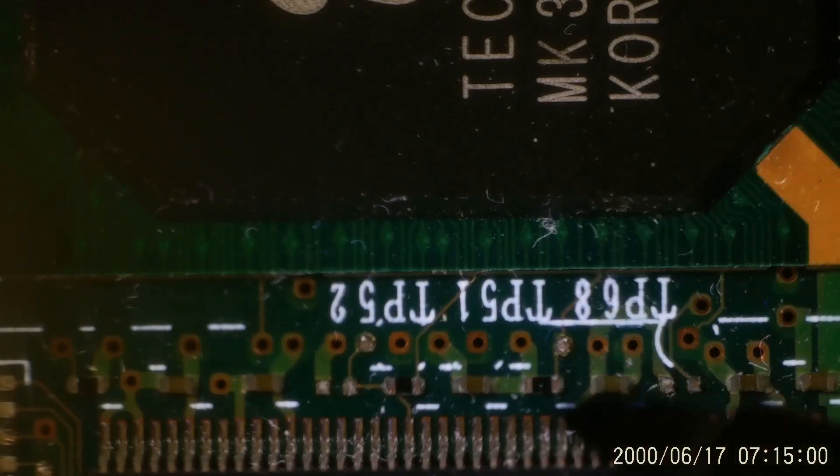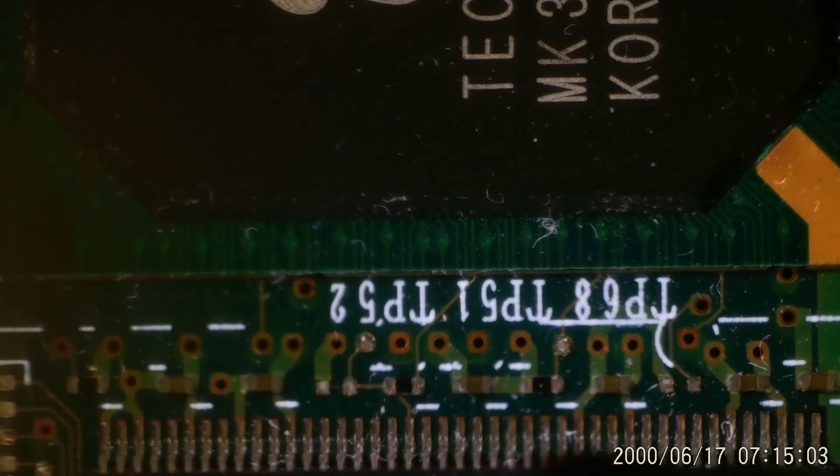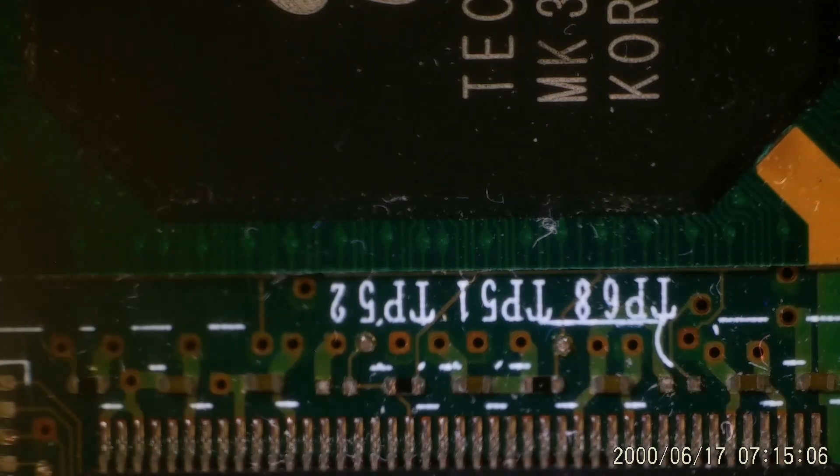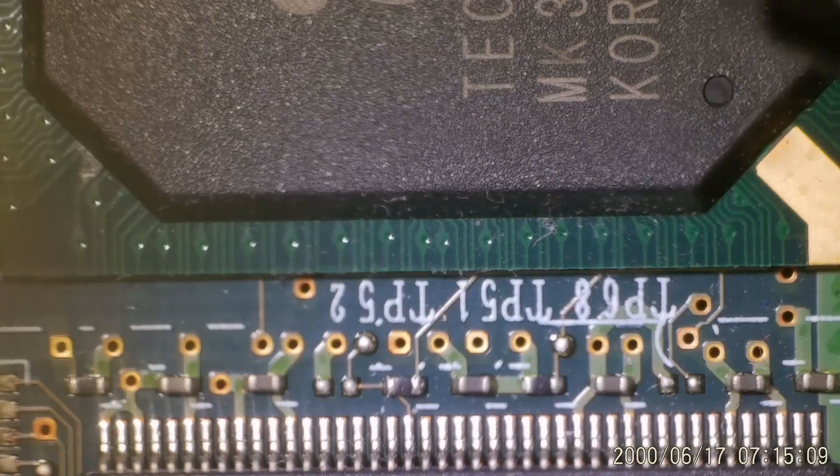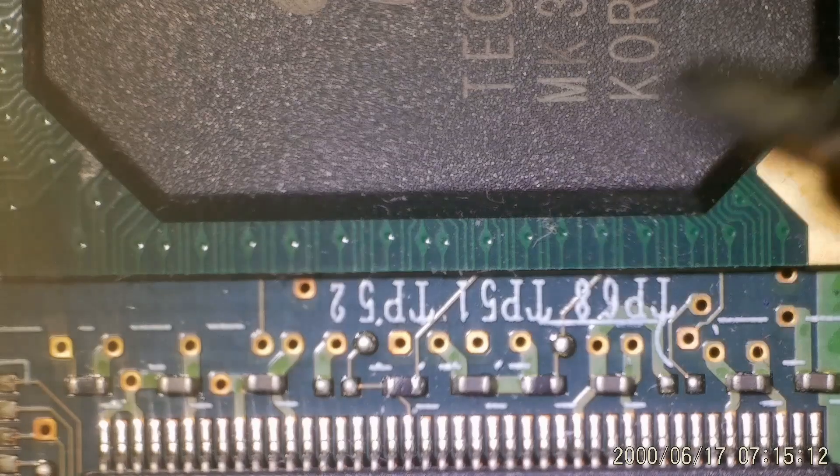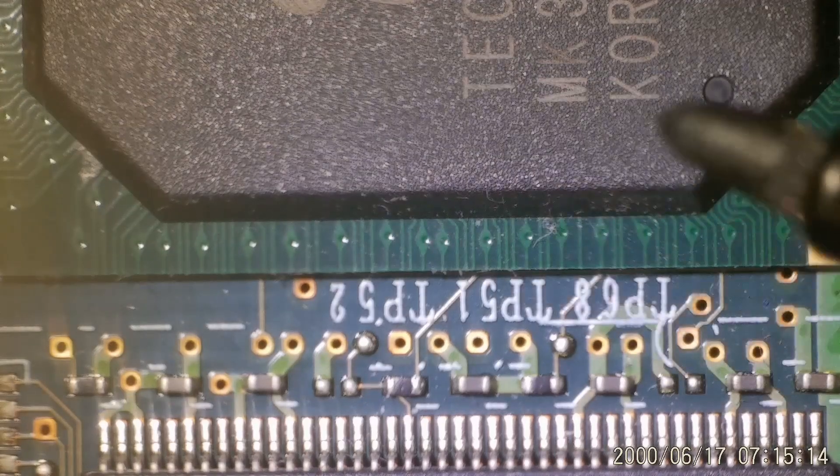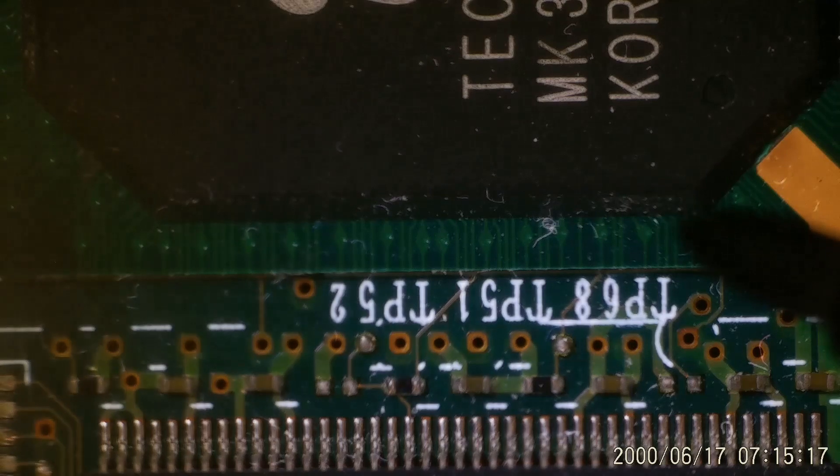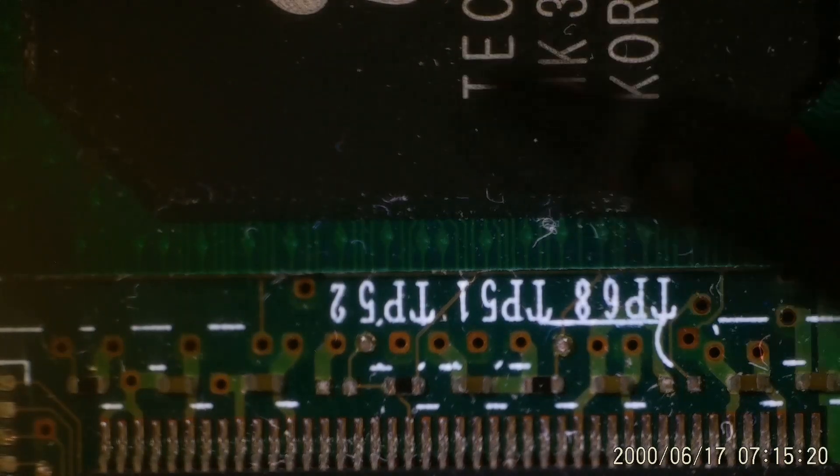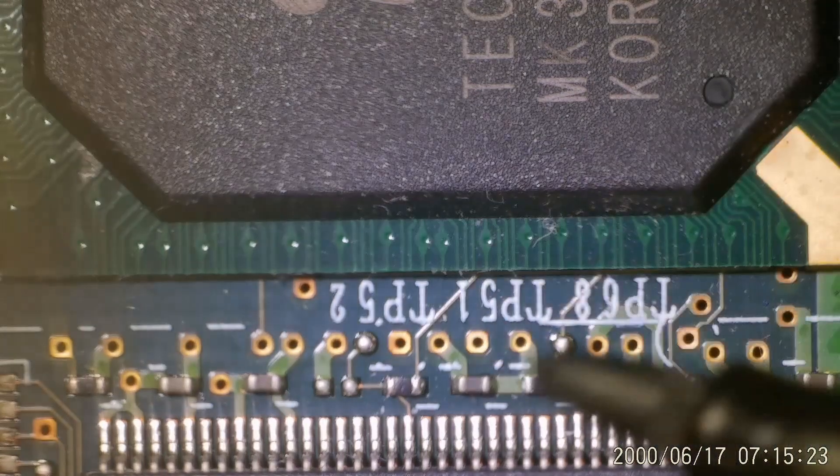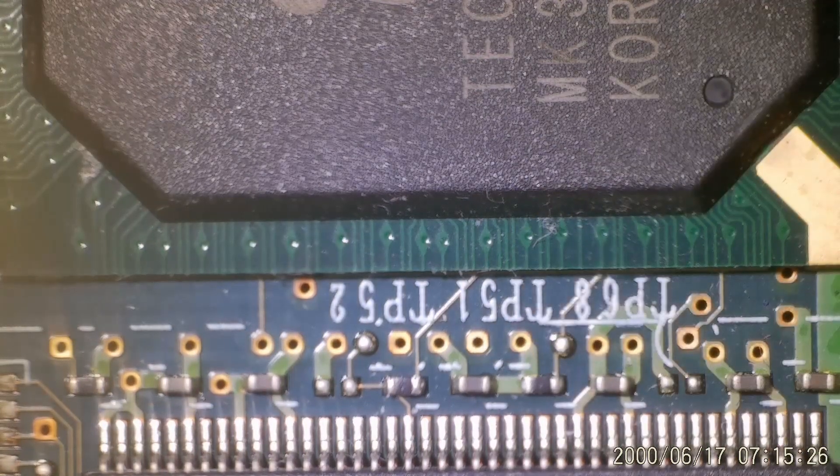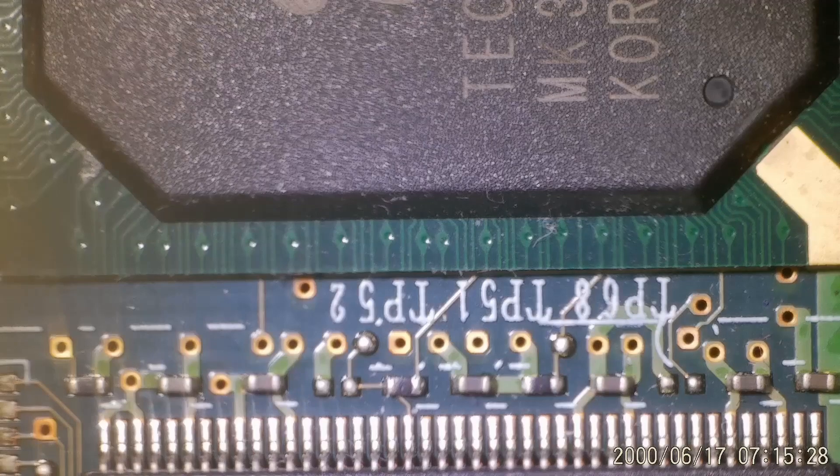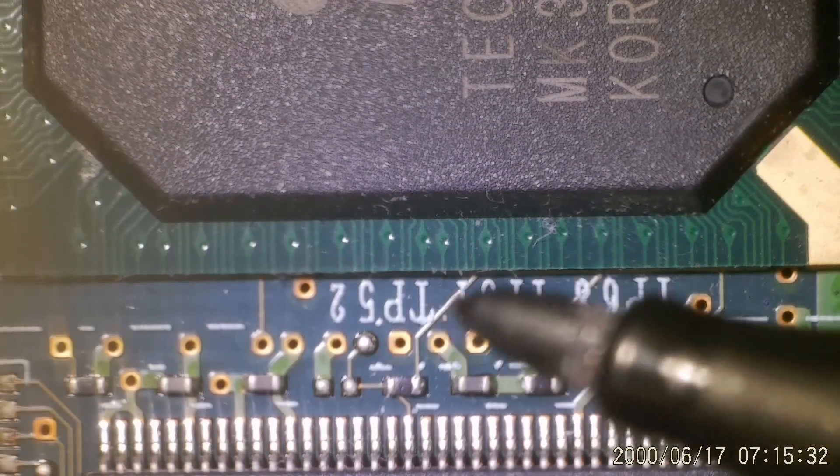So on my lens, I can tune out all the metallic surfaces, and I only see the labels, some similar effects here on this plastic surface of the chip. I can get that really dark, but the labels are still here. So I don't know, but Jim Quinn might be on to something here.